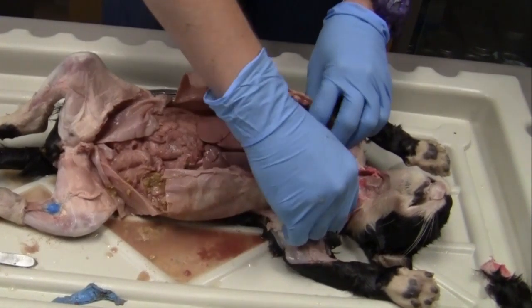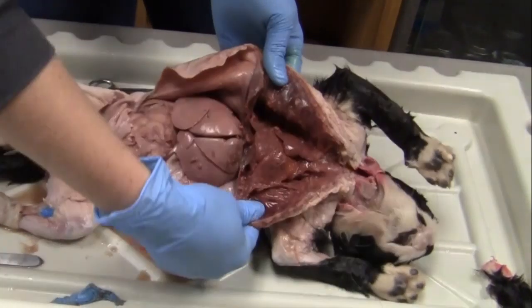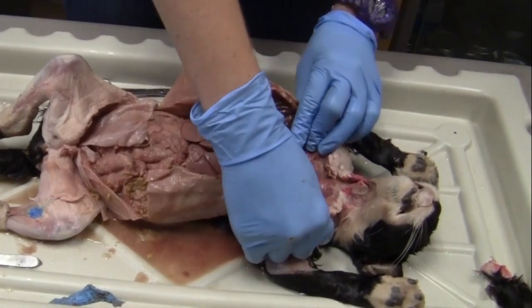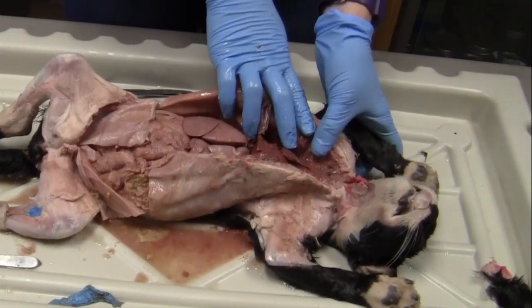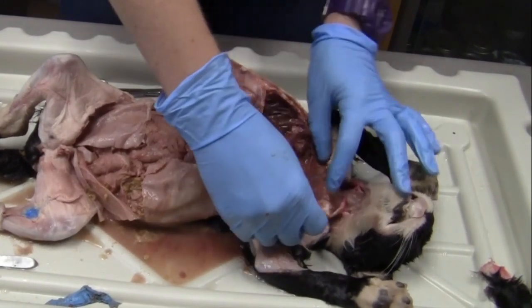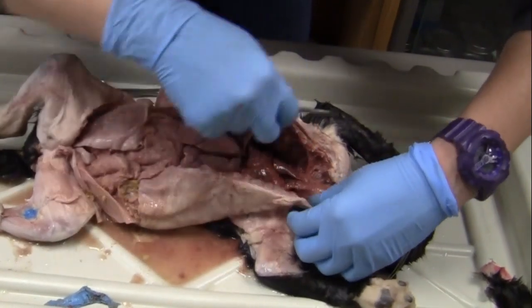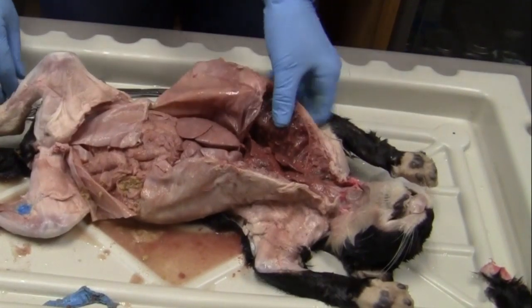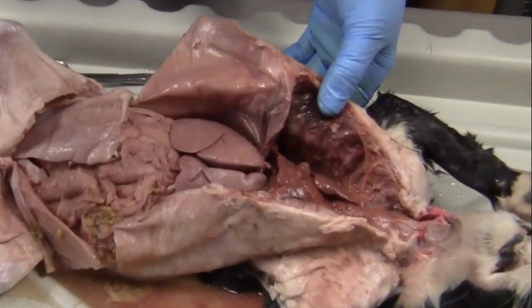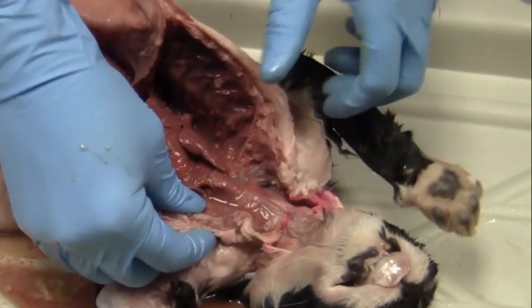Okay, so let's talk a little bit about, you guys are probably seeing that everything is very blue and red. Looks like there are lots of bright colors in here. So these cats, when they are preserved, are also injected with a plastic dye. All of the arteries are injected with a pink dye so that you're able to identify them easier. So that's really awesome. And then all of our blue is going to be our veins. So it's a lot easier to see these arteries and veins if they're injected with this dye. I can zoom in just a little bit so you can see. And you can already see up here on the neck where that dye was injected.